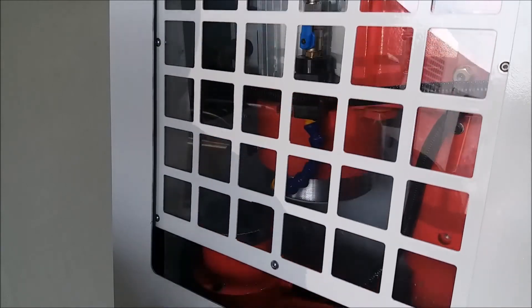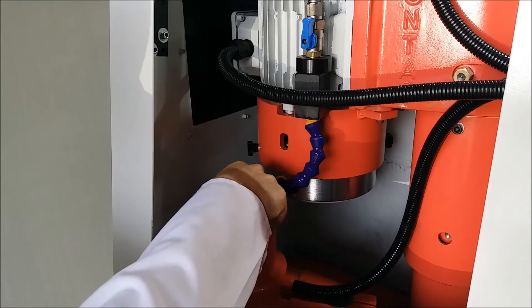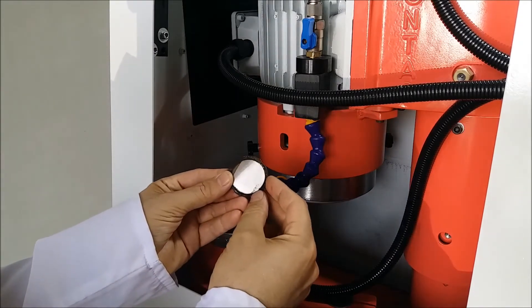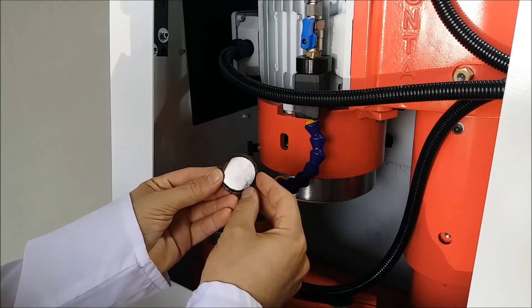When the stop button is pressed, the grinding stone and water pump stop, and the SG-150D implements a demagnetization process on the sample. The demagnetization process helps removing the sample from the magnetic surface. SG-150D does this automatically.